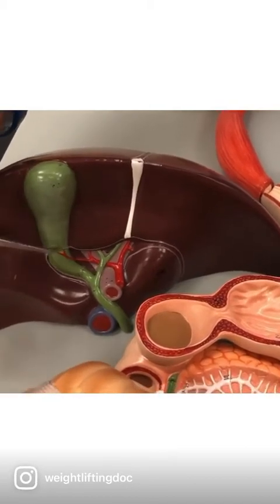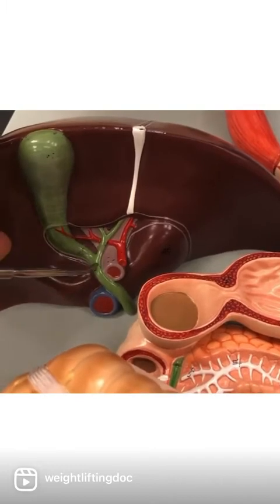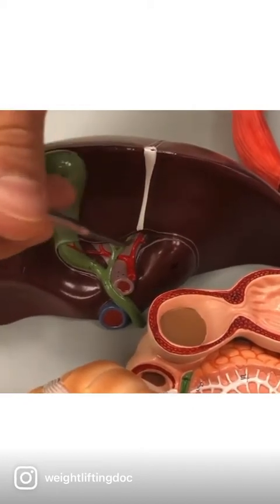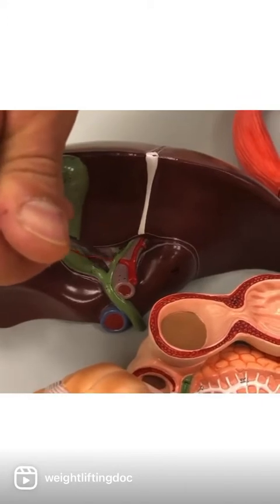Now we have a duct system here. The duct that connects directly from the gallbladder is called the cystic duct. Coming from the liver, we have one duct coming from the left lobe. This is the left hepatic duct. Coming from the right, we have the right hepatic duct.